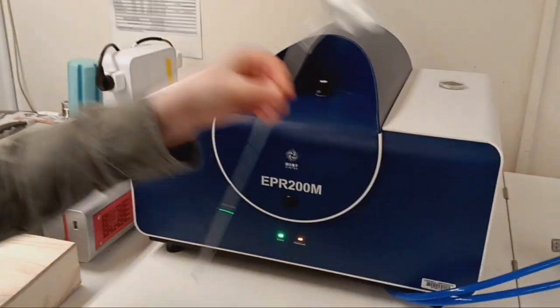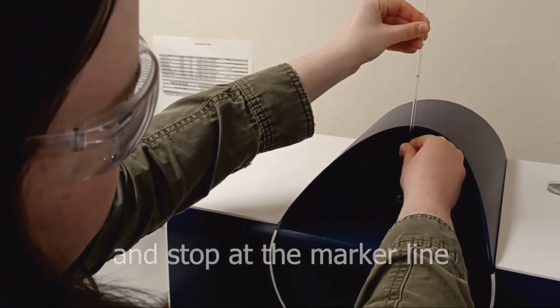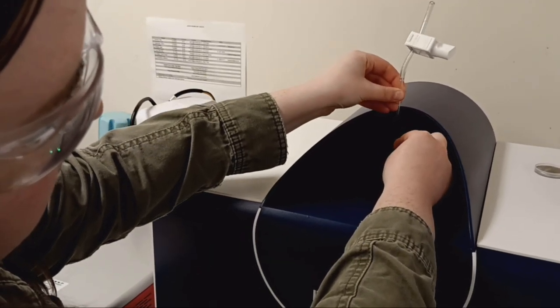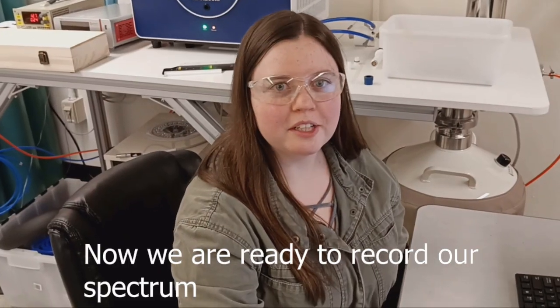Next, we are going to load it into the spectrometer and stop at the marker line. Now we are ready to record our spectrum.